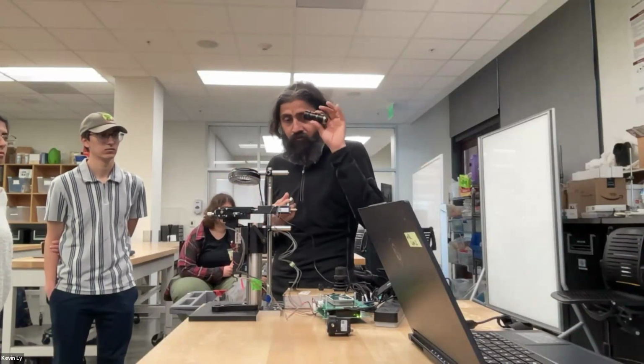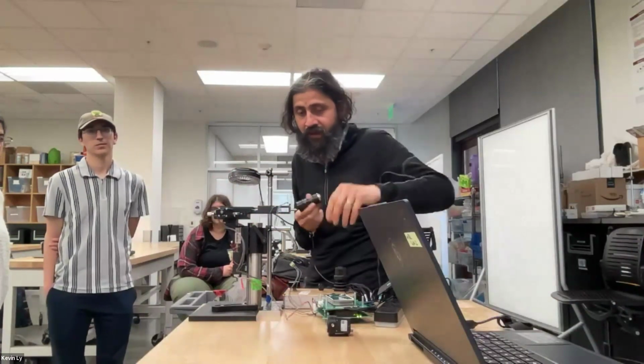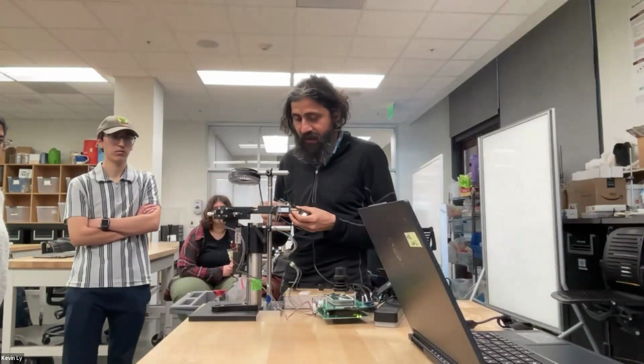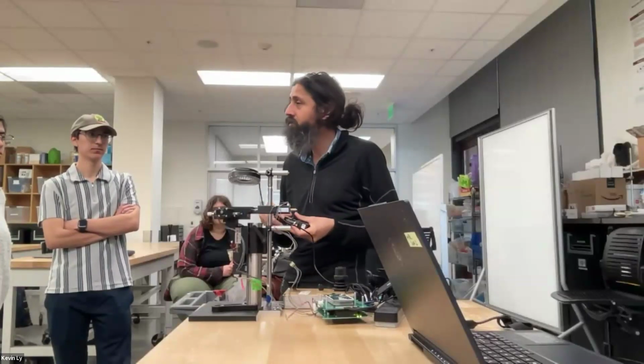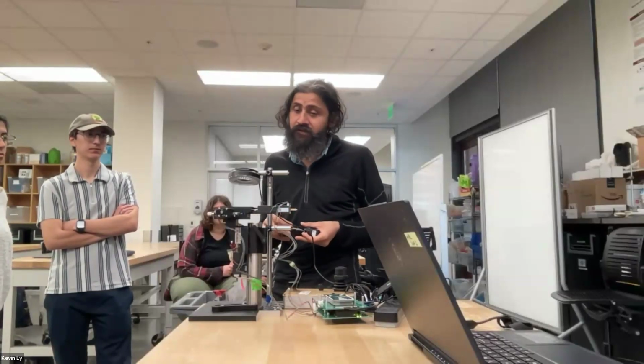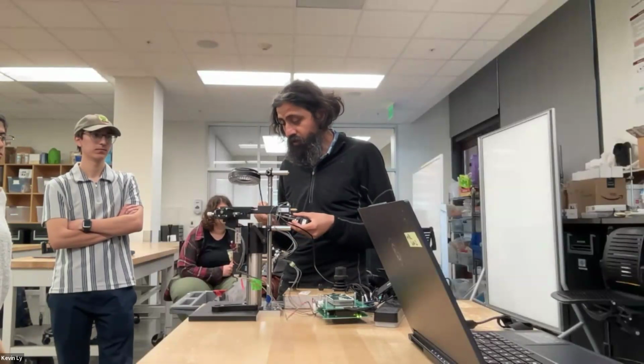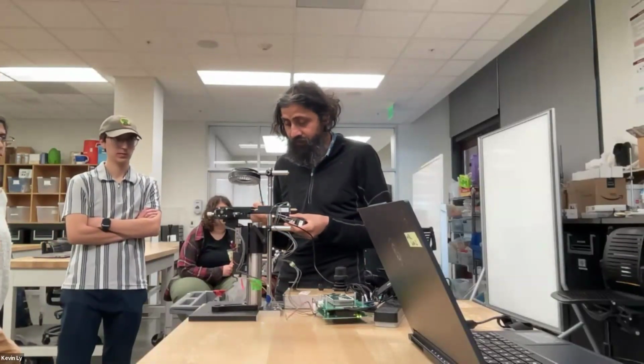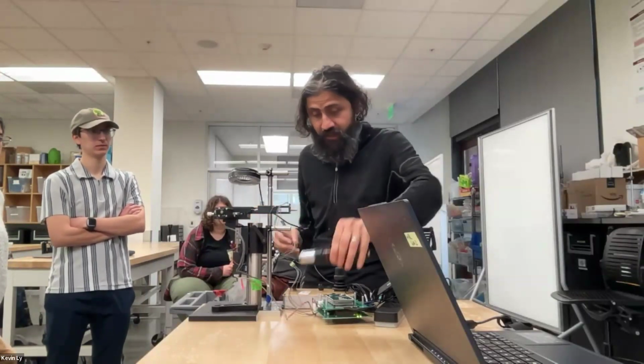Okay, so we found these sets of things and we found cameras, and then we started realizing that, okay, now this becomes the first core of a microscope, but it's still not a microscope because I would just be moving it around. I don't have any control. Then we started building these modules. And again, the whole purpose of the SQUID paper, if you all spend time reading that paper, you'll realize that there are many hidden modules.